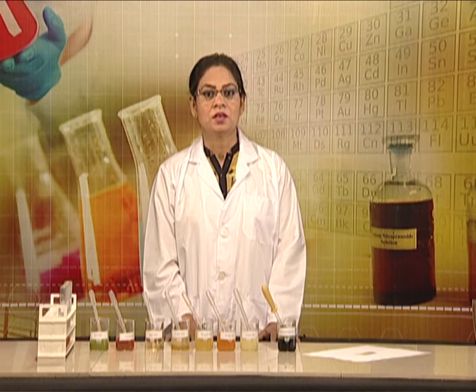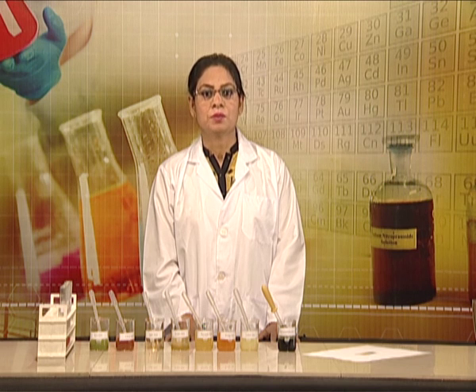So, learners, today we have learned how to determine the pH of fruits and vegetable juices using universal indicator.